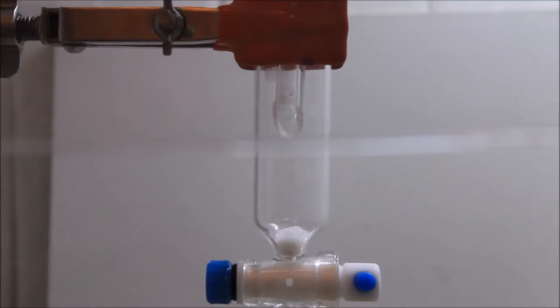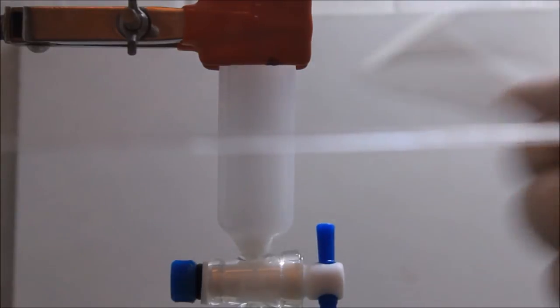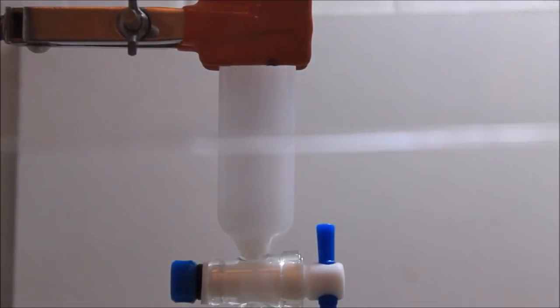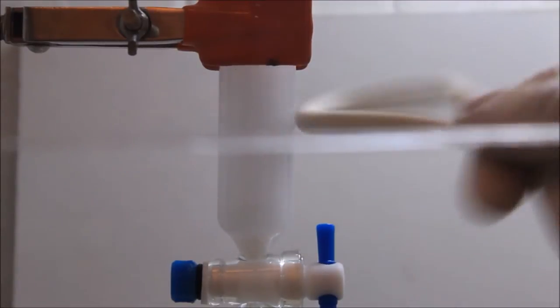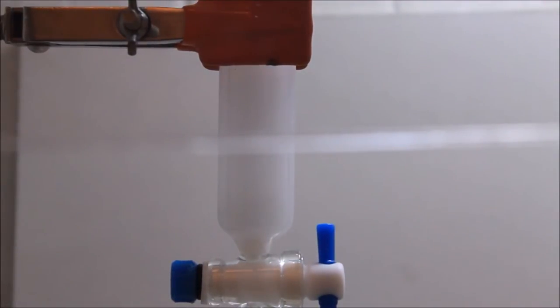The slurry is then poured into the chromatography column. The stopcock is then opened and the column is tapped with a rubber tube. This step is extremely important in order to eliminate any air bubble that might be trapped in the stationary phase, producing a poor separation of the components of the sample. Some air pressure can be applied by flushing air through the column; this will accelerate the packing of the stationary phase.